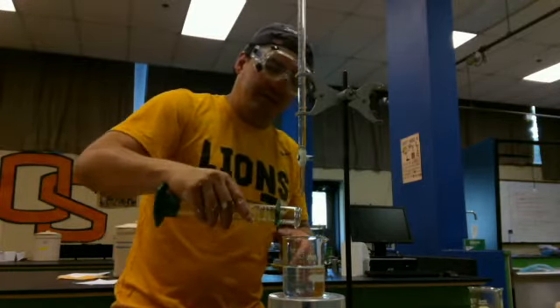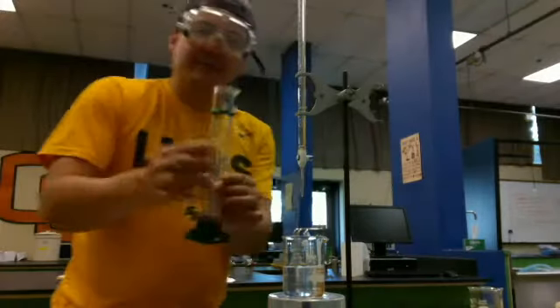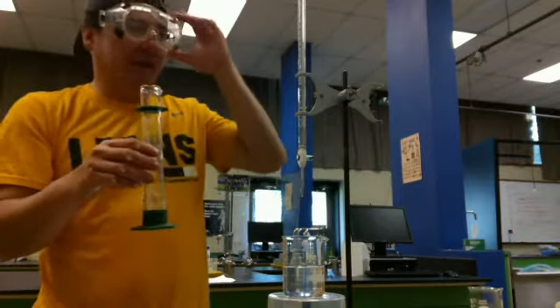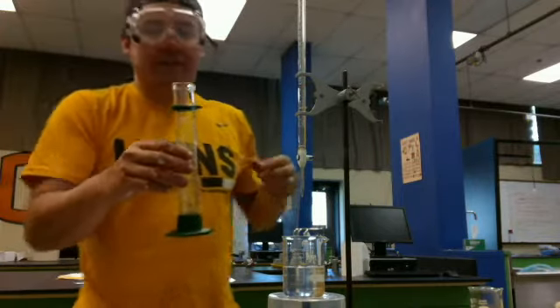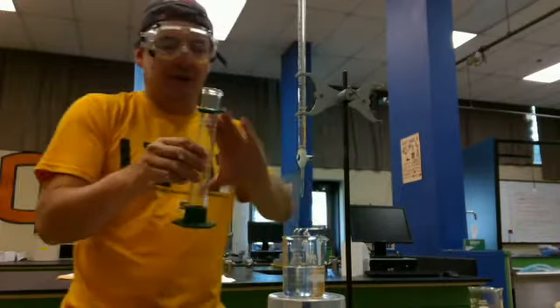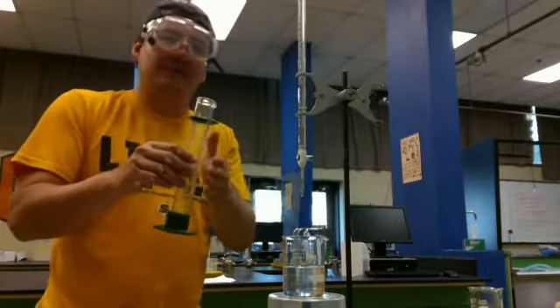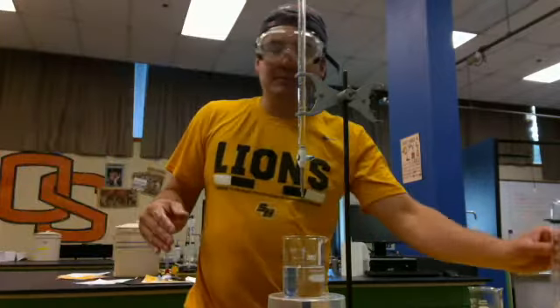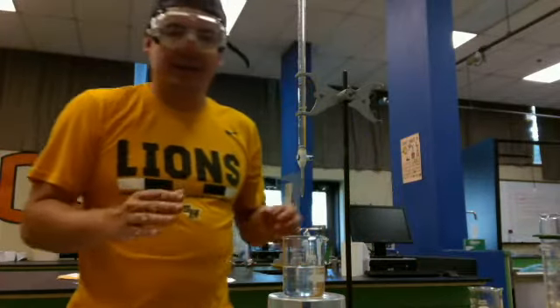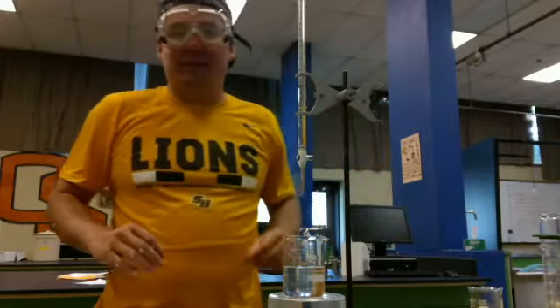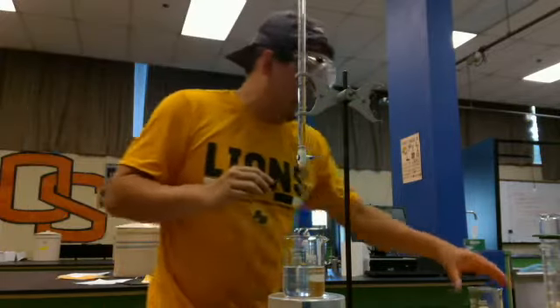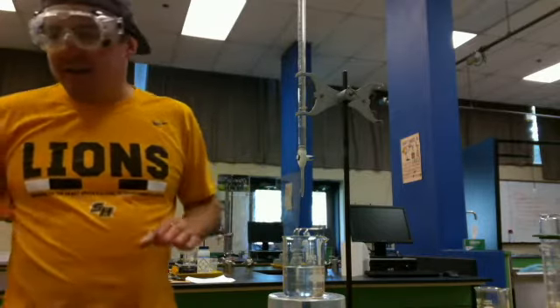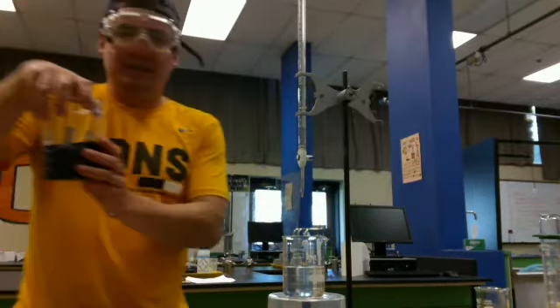So I'm just going to check. So there's 100 and 50. Now, you'll notice I'm not going to be super precise. There's still some of that sodium hydroxide in here. If I was doing this repeatedly and trying to be very precise, I would rinse with water all of that 150 milliliters. I would make sure every bit of sodium hydroxide that I've measured has made it into there. For simplicity, I'm not going to do that. But that's just like the better you get at something, the more precise you get. So I'm just practicing.